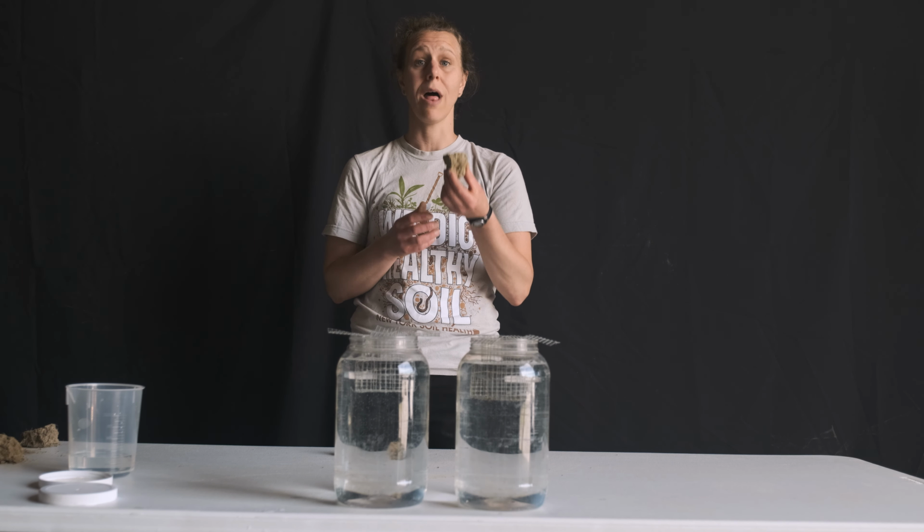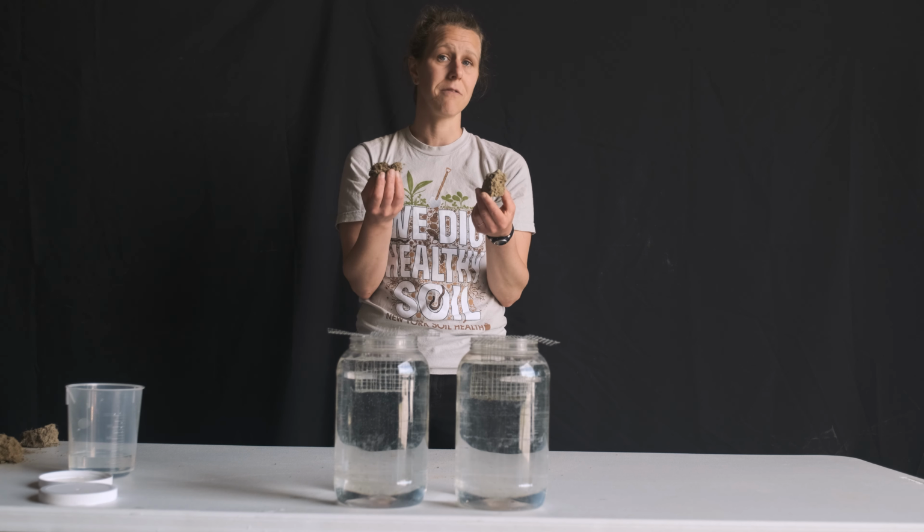or something like tillage. So here we're showing the slake test, or simply the aggregate stability test. So I have two soil aggregates and you can see they look drastically different. The one in my right hand is from a continuously cropped with tillage system, and the one in my left hand, you can hopefully see roots, you can see clumps of soil. This is a permanent cover, no-till system. These soils are the exact same texture, a silt loam soil, from about 10 feet apart.